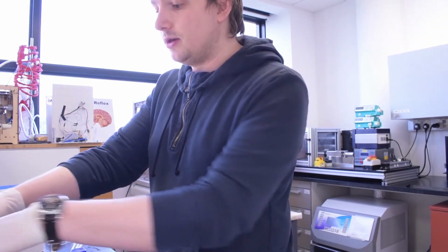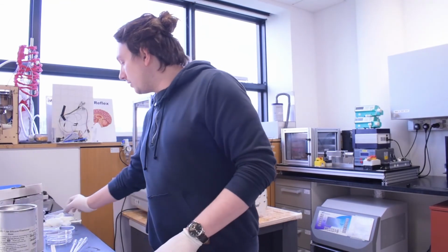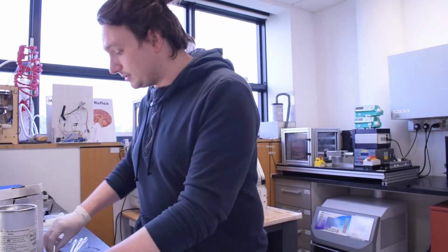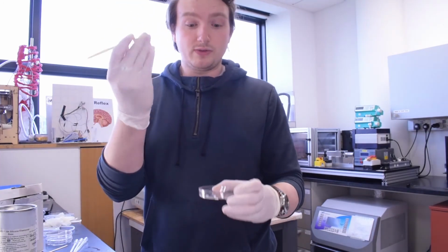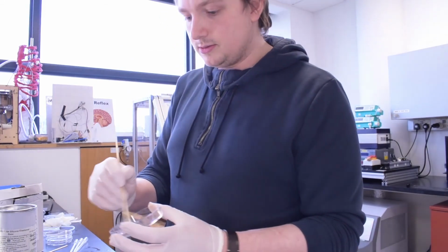Because the silicone is made of 2 different parts, we have to be really careful and mix it super thoroughly. If we don't mix it thoroughly, it's not going to end up setting, or you're going to end up with a mixture that's partly set in some places and partly liquid in other places. So go ahead and take a coffee stirrer and mix together the 2 parts.